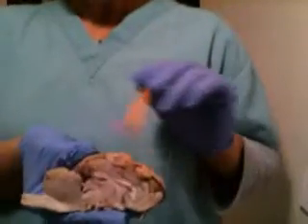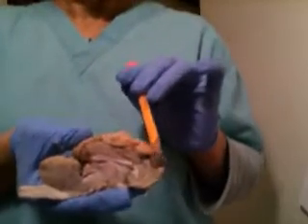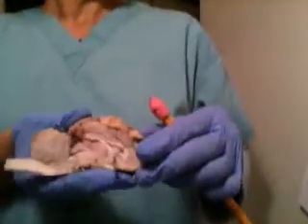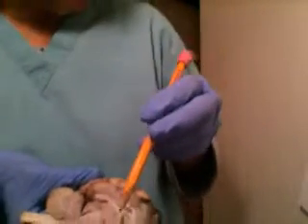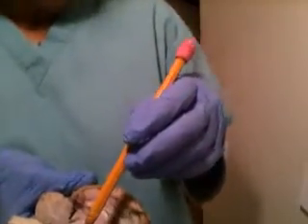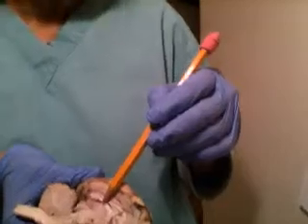on the big area, the frontal section is the cerebrum. Okay, and that's it. And the pineal body is the little part here. It's the pineal gland, right on top of the thalamus. So I guess it's a little tiny part here.